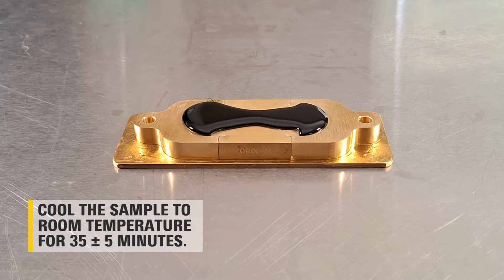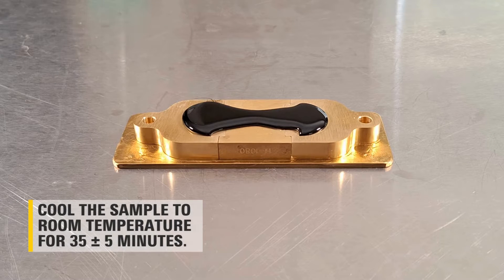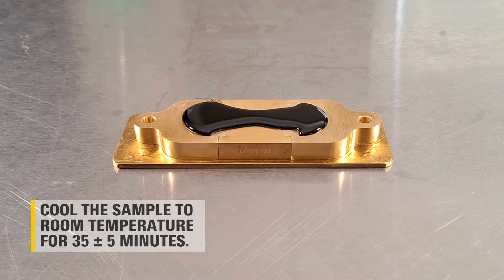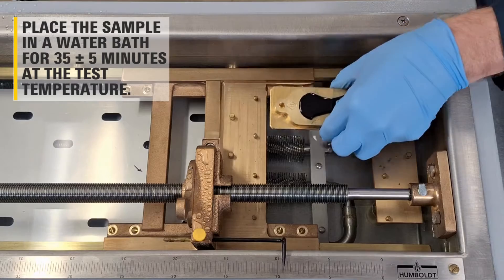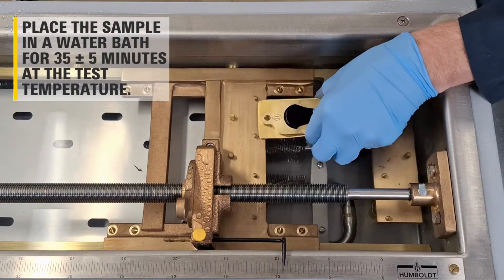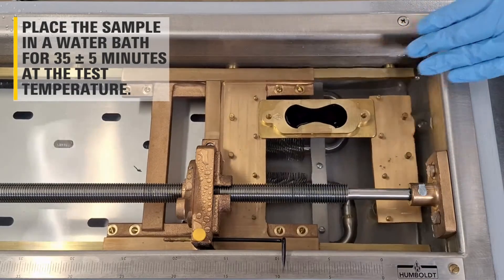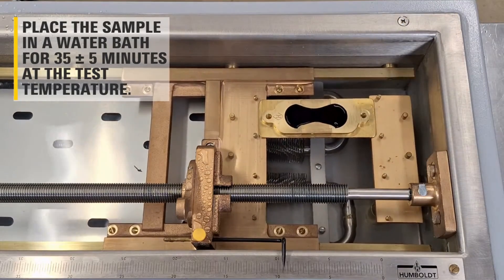Cool the sample to room temperature for 35 plus or minus 5 minutes. Place the sample in the water bath for 35 plus or minus 5 minutes at the test temperature.